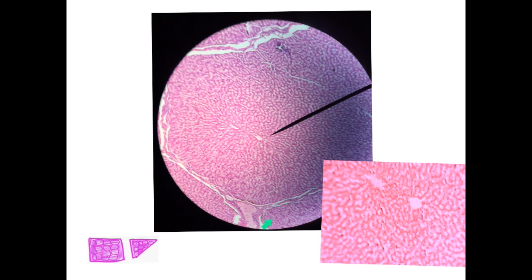A very easy lobulated structure is the liver of pig. Any mass can come triangular, rectangular. However, under the microscope, the picture is very characteristic. You can see the hexagonal lobule due to the presence of these trabeculae, and inside you will notice the central vein and the cords of the liver cells radiating from this central vein towards the periphery. Again, central vein and the cords of the liver cells.